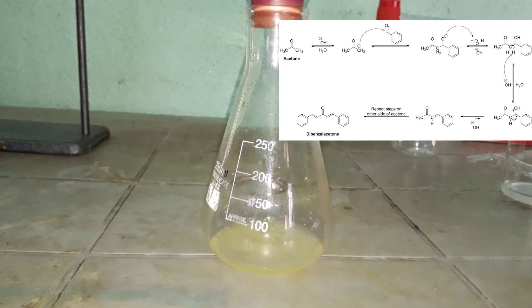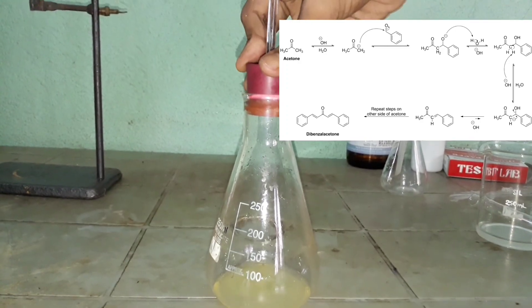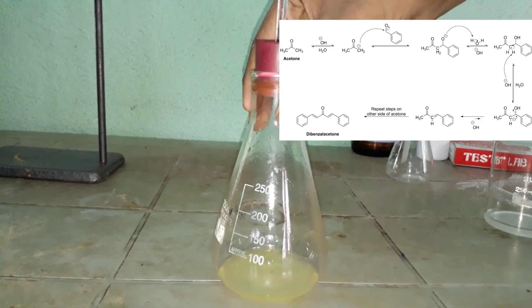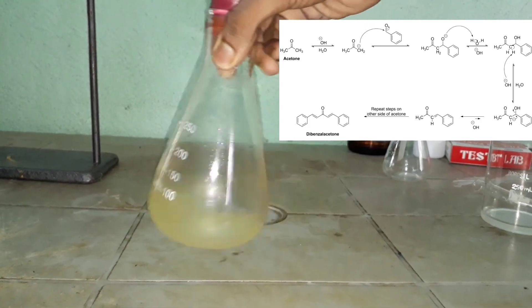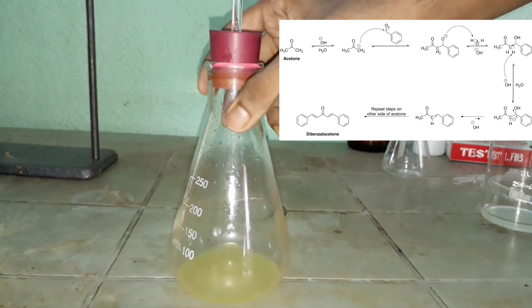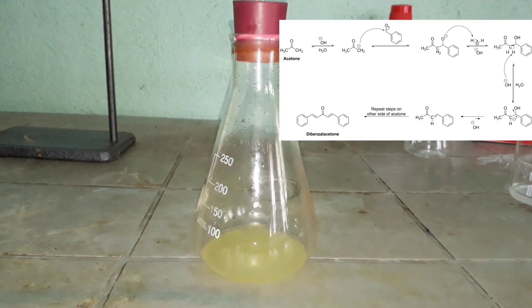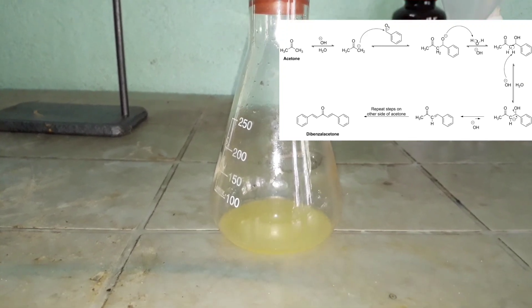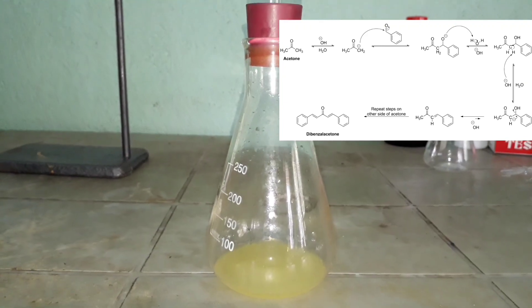Then another OH⁻ deprotonates the intermediate, which generates a negative charge. The electrons move to form a double bond and the OH⁻ is kicked off. This regenerates OH⁻, and benzalacetone is formed in this step.